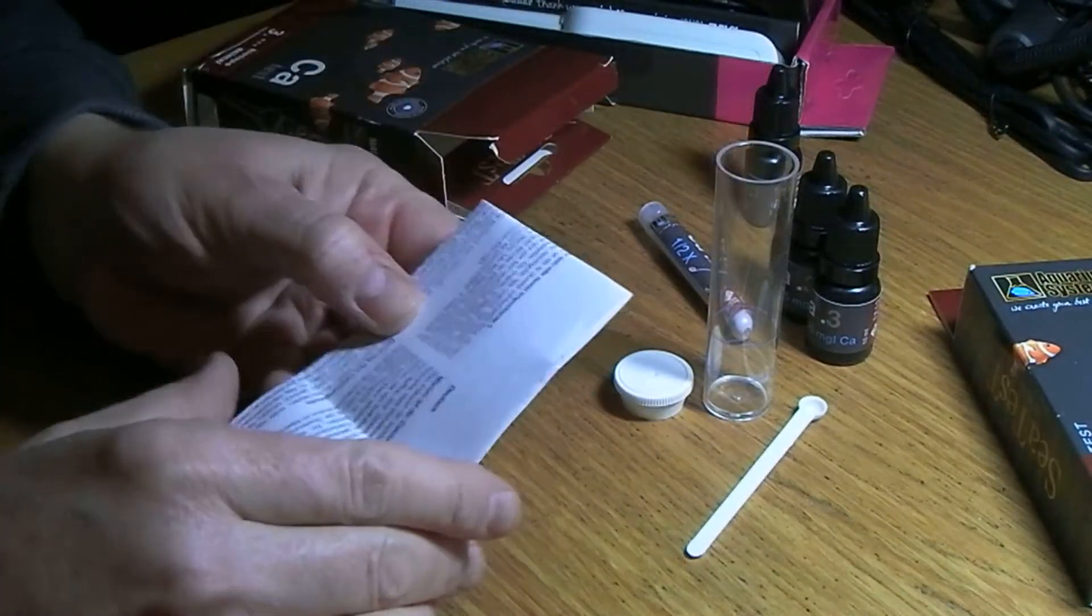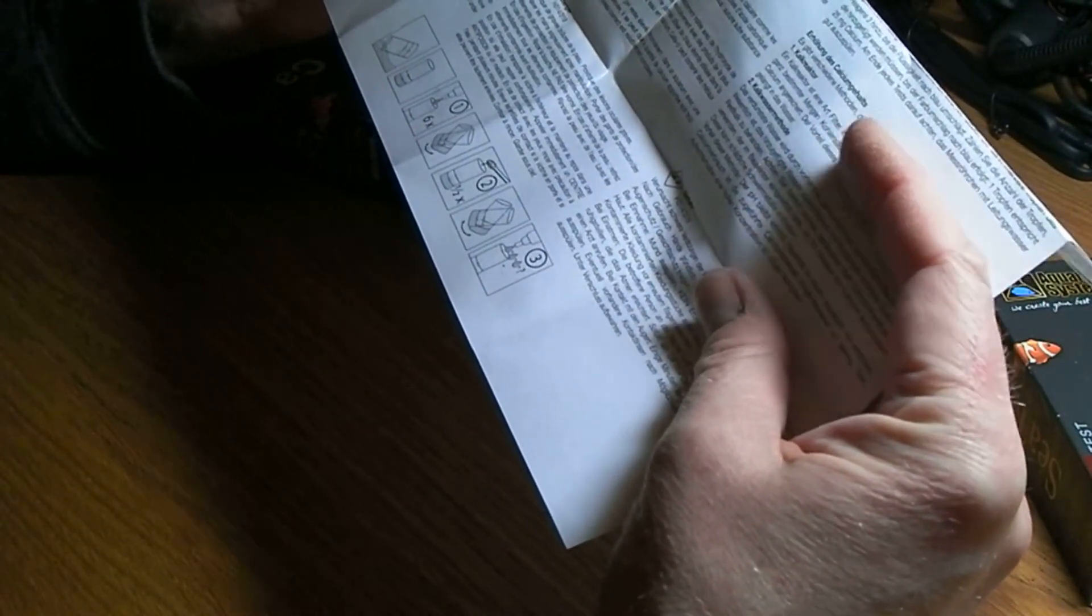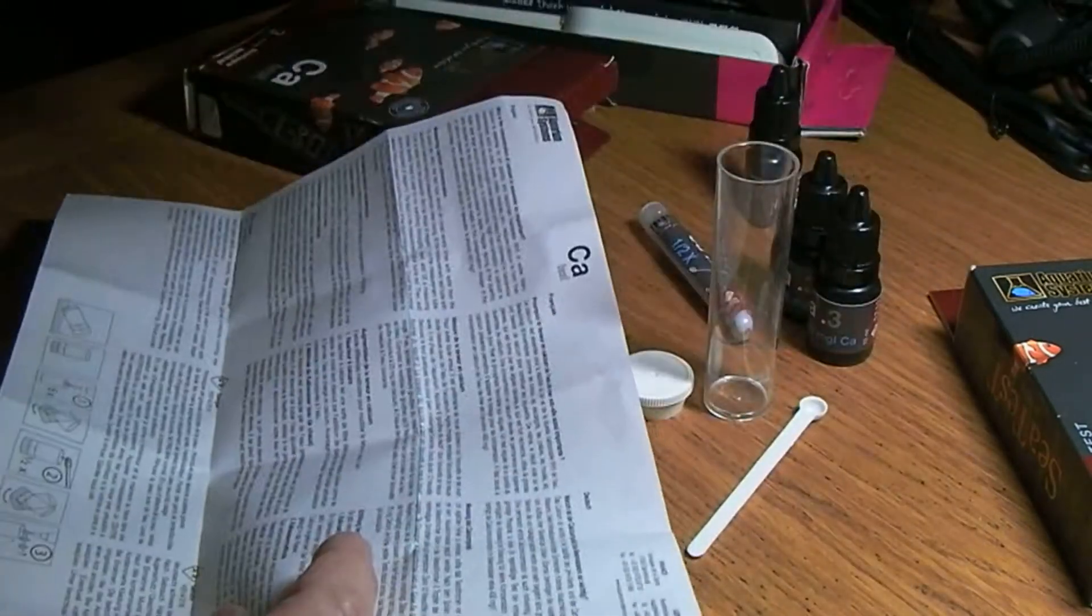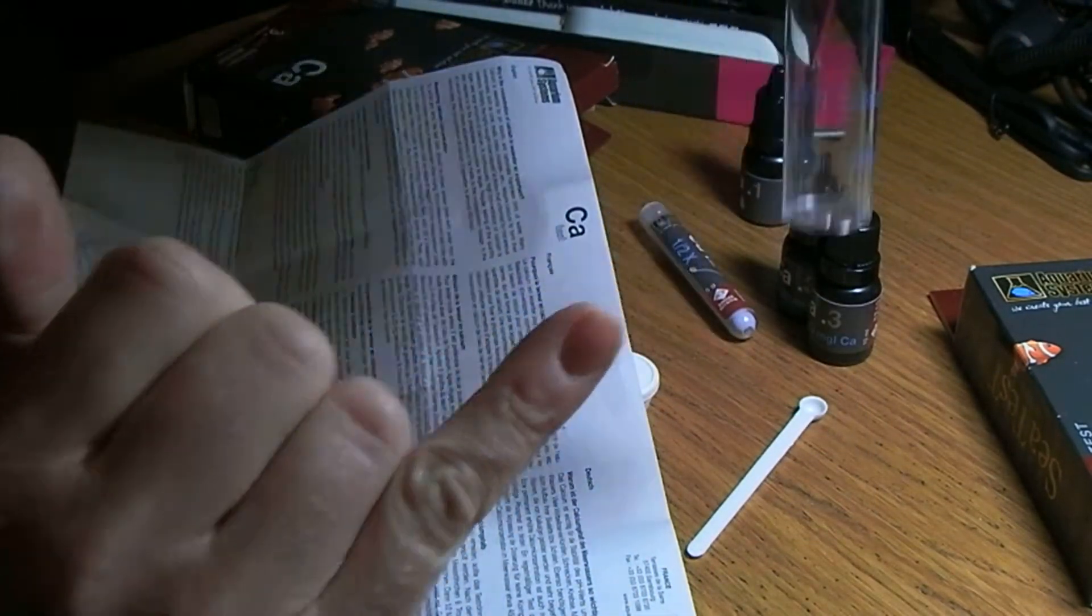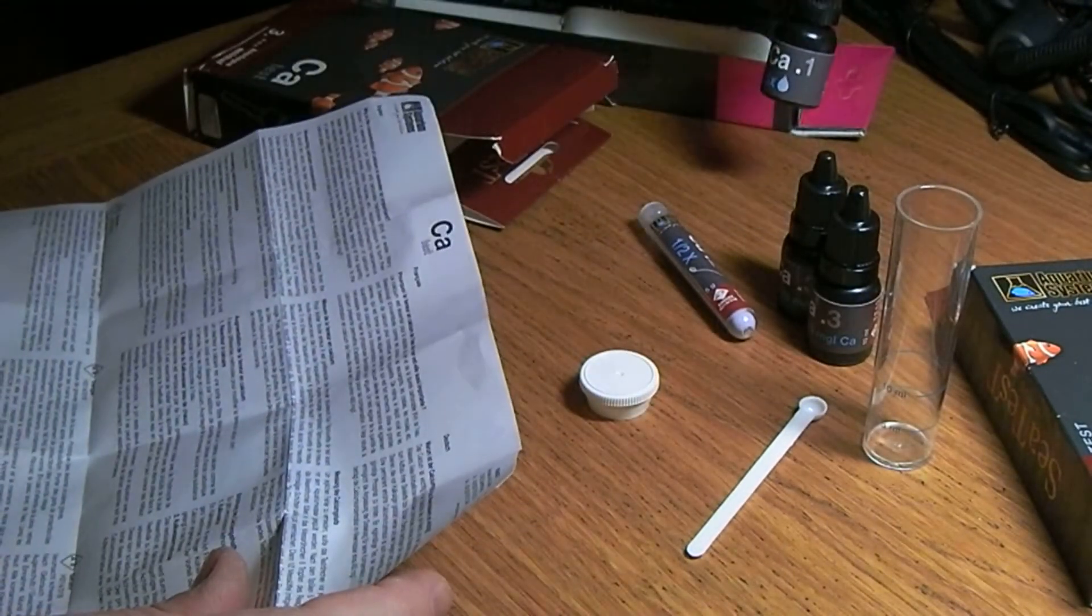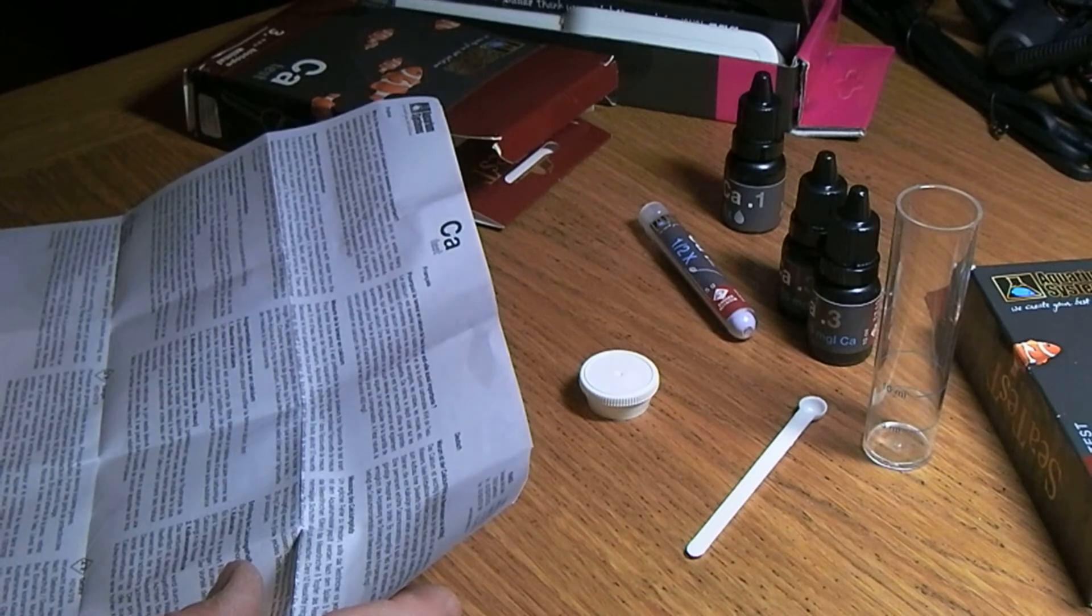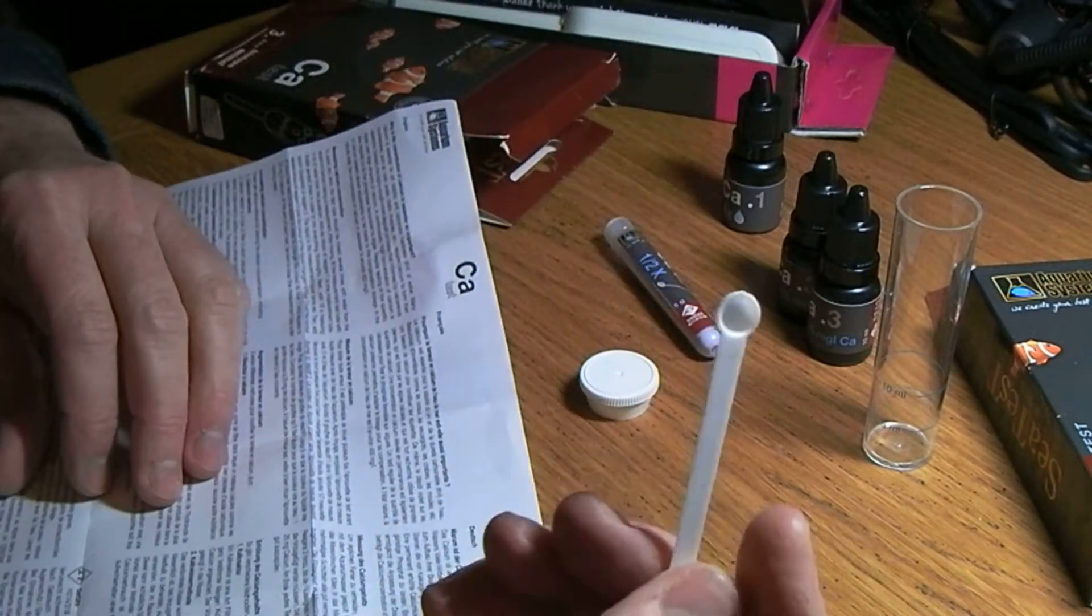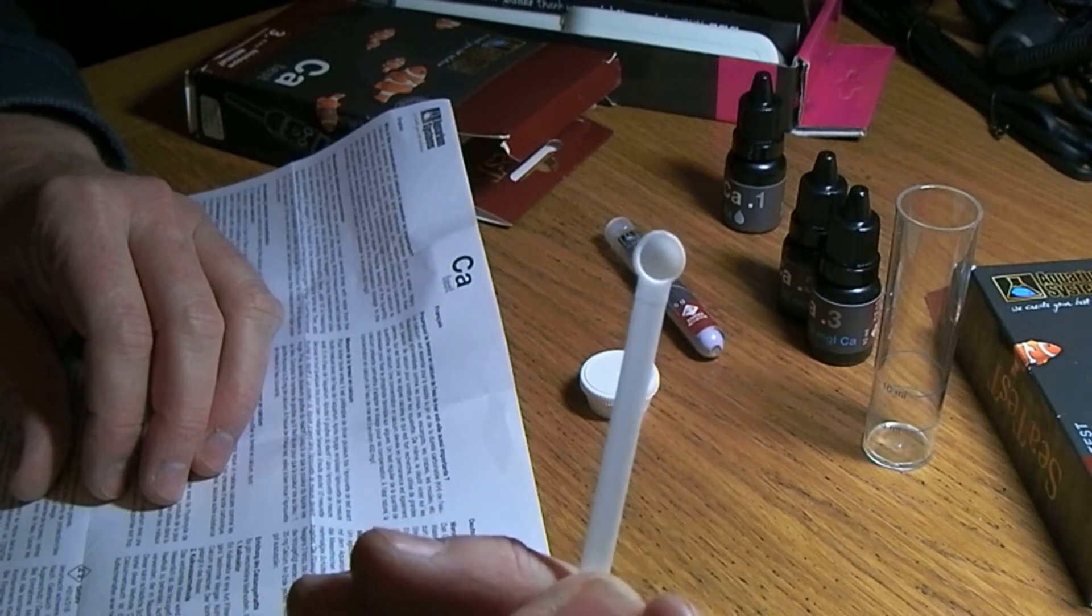Yeah, okay, so that's everything. Don't think that box is going to last very long but I'm going to try and tape it up to keep everything in. I expect we've probably got basic instructions in about 20 languages. This particular one requires okay, so five milliliters of water - I use a syringe but there is a blue line at the five and ten milliliter mark - six drops of number one. Then step two is, oh that's ridiculous, half - you're supposed to get half a scoop of the powder.